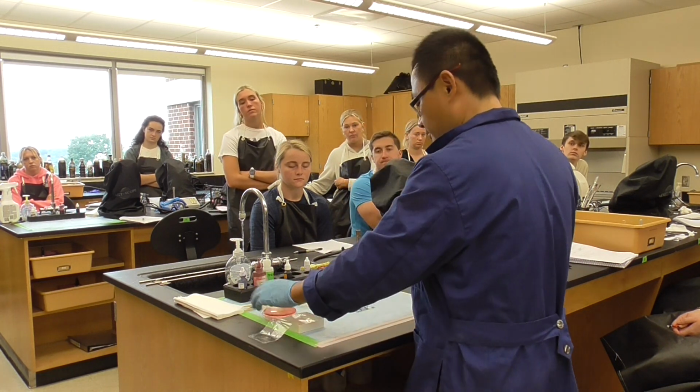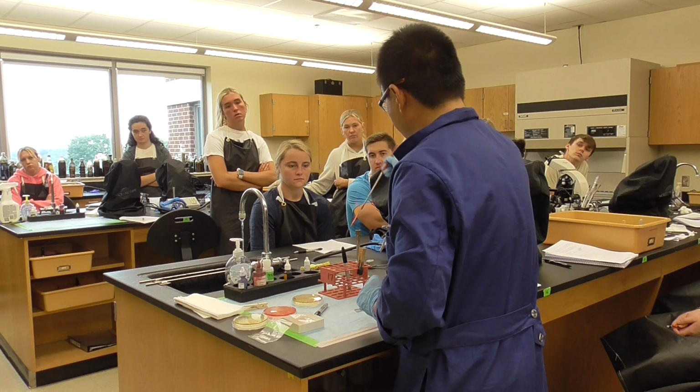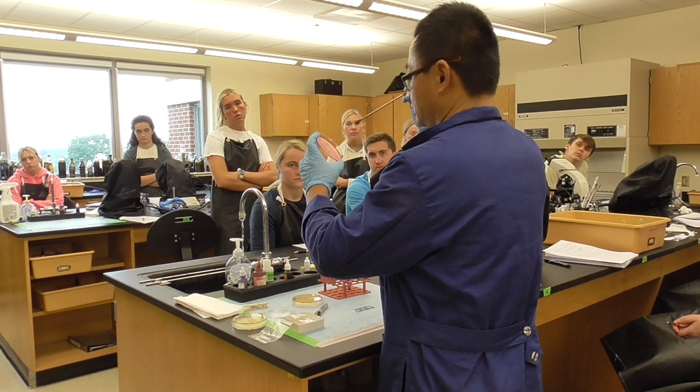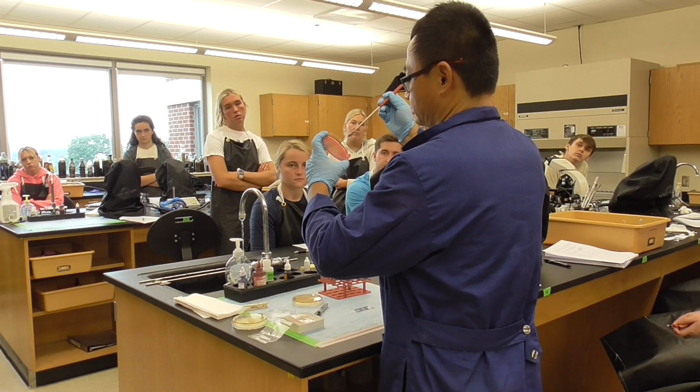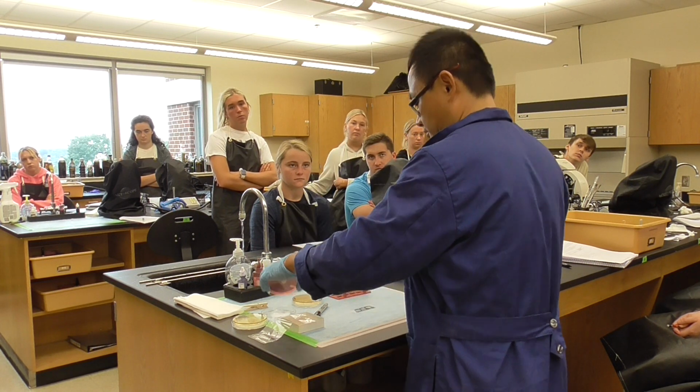The second one, I'm trying to use my own culture to see whether the Staphylococcus aureus is there. Maybe it did not grow, but we'll see. So I'm going to cool down the loop and try to pick some. So whether it's growing, I don't know yet. We'll see.